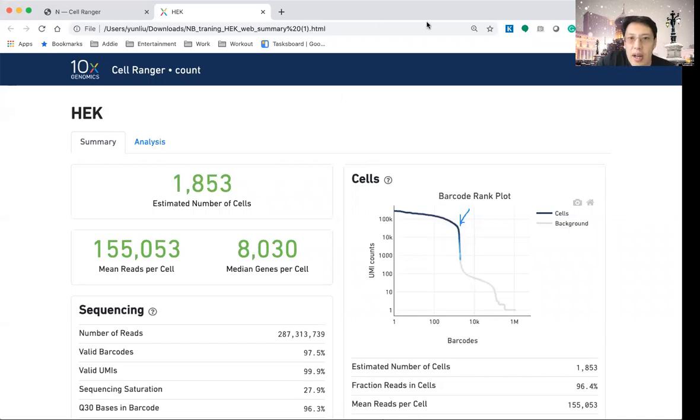So in that case, I will see something like this, very gradually dropping, something like this. If I look at this type of shape, that means that I'm not confident any of the bubbles trap a real cell, because it's not significantly higher than the random case, because you would expect to see this gradual drop anyway. But for this case, as you can see, up until here, those are the real cells. And after that you can see that the number of reads being detected suddenly drops to a very, very low level, only a few dozen reads per bubble or per cell. And in that case, those are the non-usable cells.